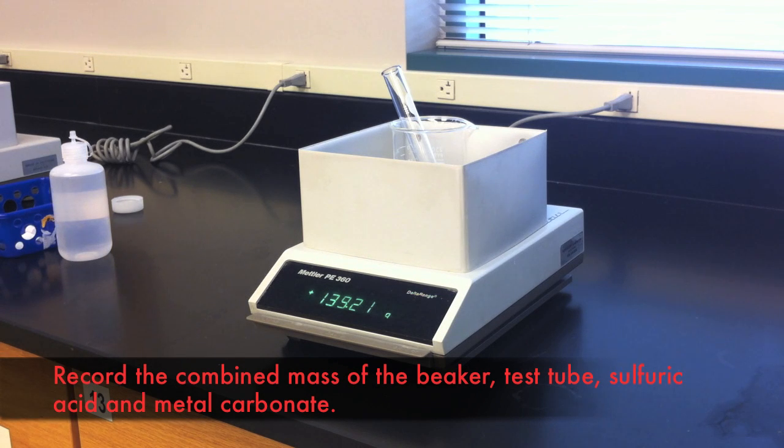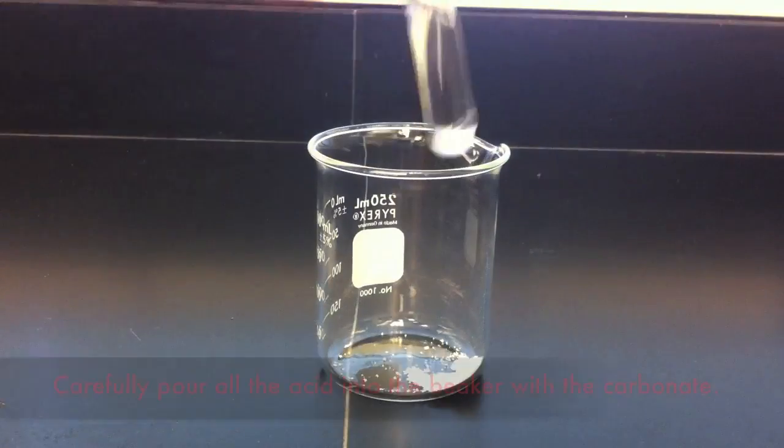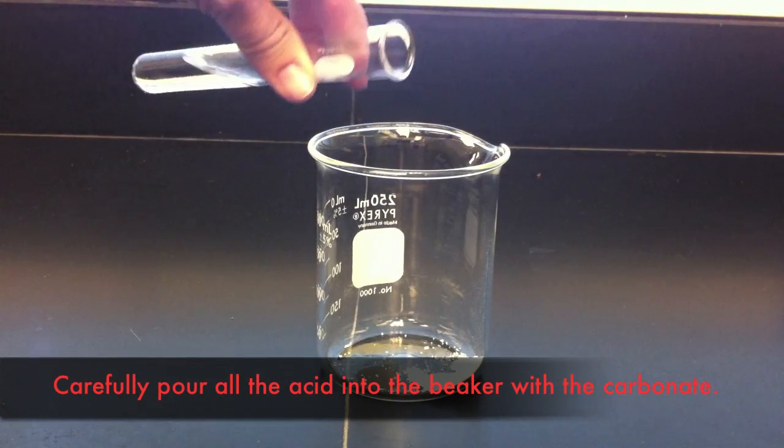Record the mass of the beaker, test tube, acid, and solid now that you have added them all together. Once you have recorded the masses, you may proceed with the reaction.